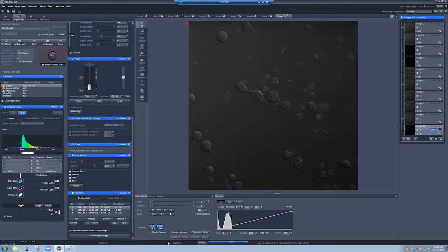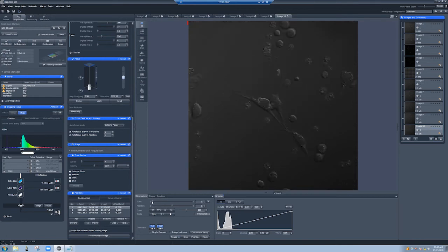So it's focusing. Take an image. Take another image, and take another image. So you can see that now there are sliders for time and position. So this is the three time points for position number one. These are the three time points for position number two. And these are the three time points for position number three.